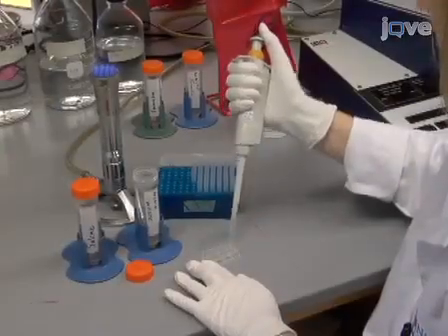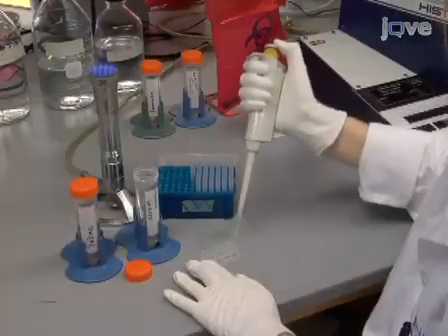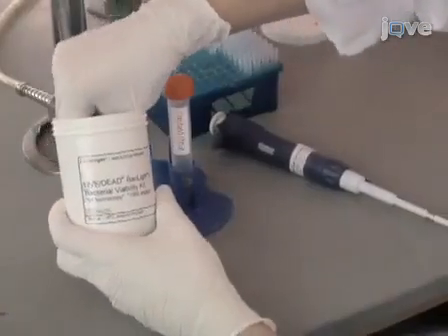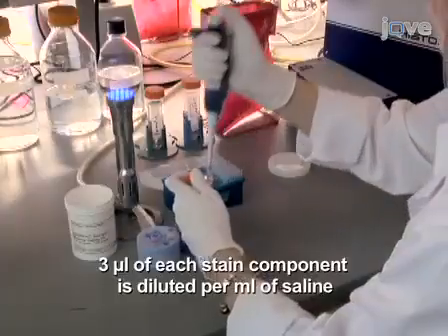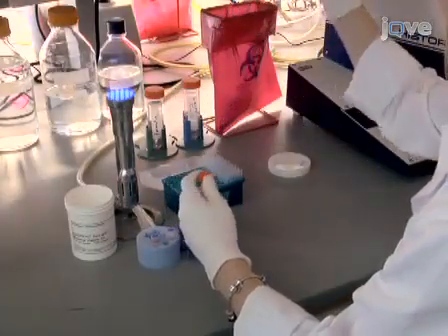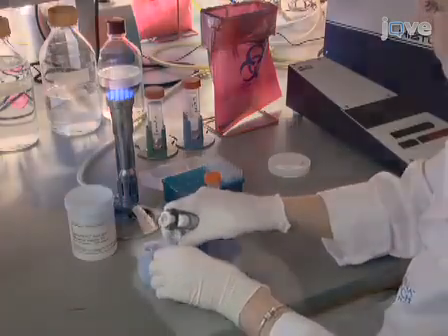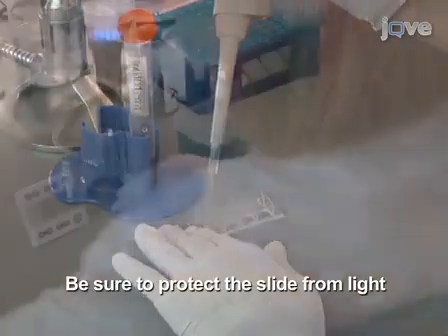To visualize the biofilms, first remove the culture supernatants as described earlier and gently wash the biofilms twice using 200 microliters of sterile saline. Once the biofilms have been washed, add 200 microliters of BacLight live/dead stain to each well. For one 8-well chamber slide, make up a total of 2 milliliters of the stain solution. Incubate the slide in the dark at room temperature for 15 minutes. From this step forward, be sure to protect the slide from light.